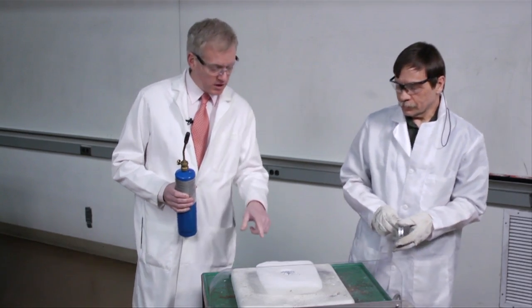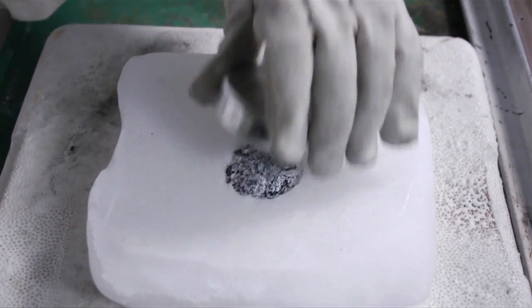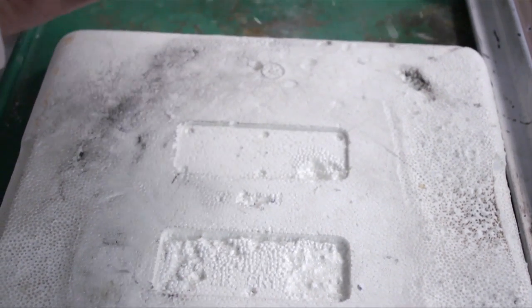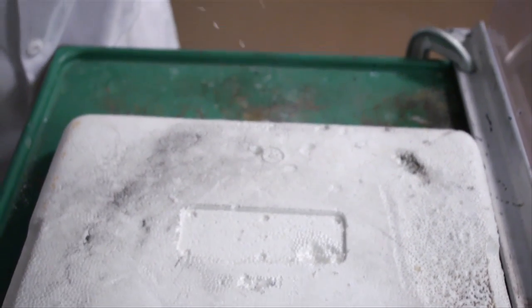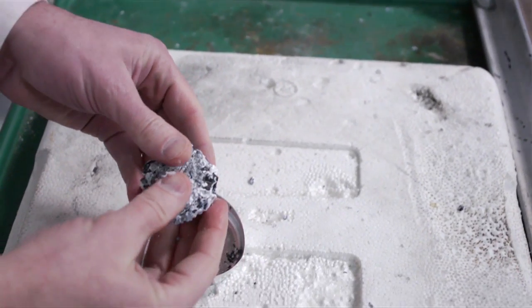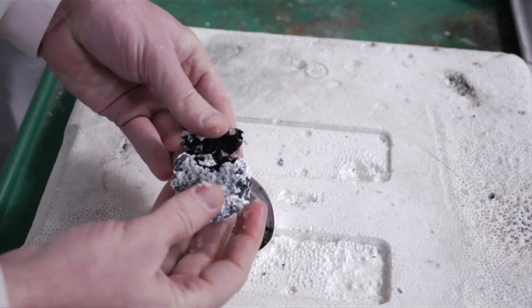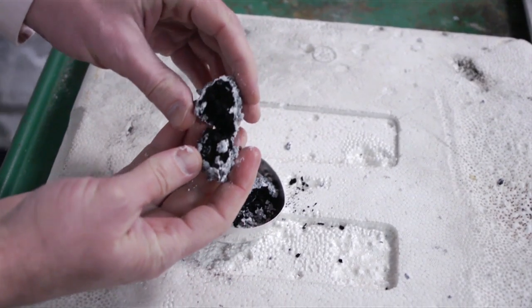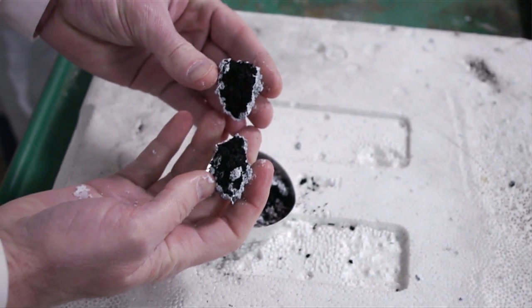Let's also take a look at the residue here in our remaining hollow. Do you see the black, sooty powder? That's elemental carbon, mixed with the more gray-white magnesium oxide.